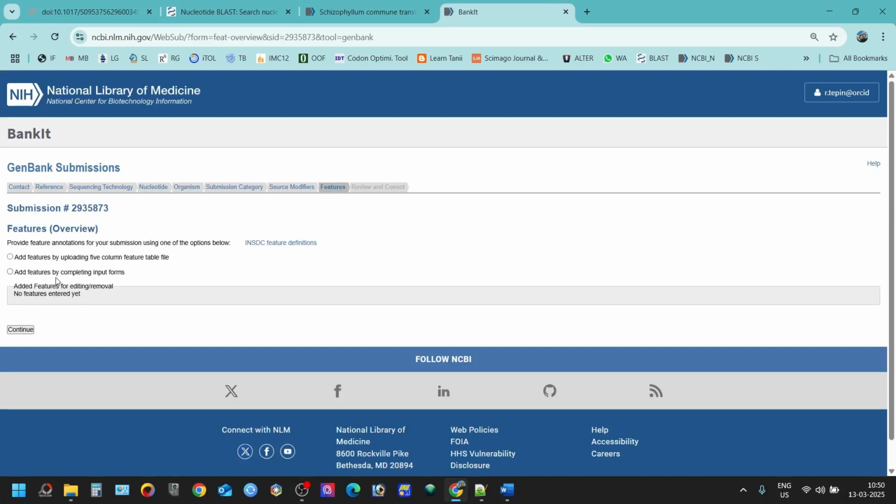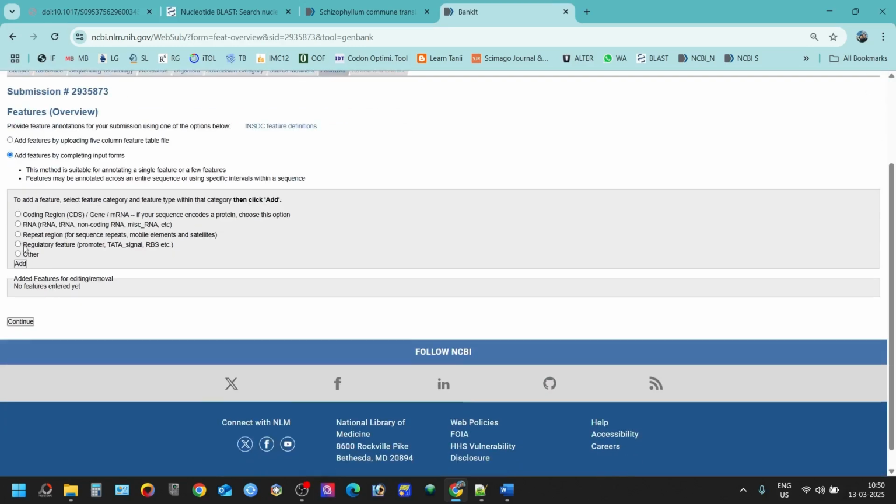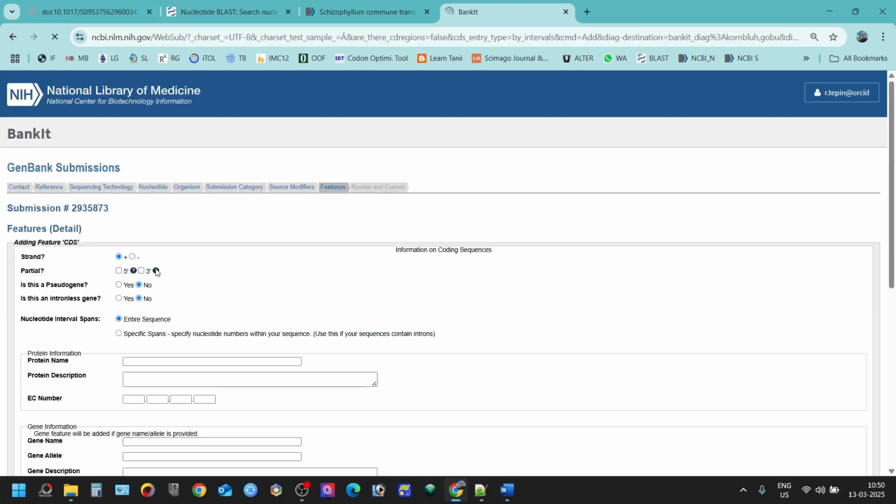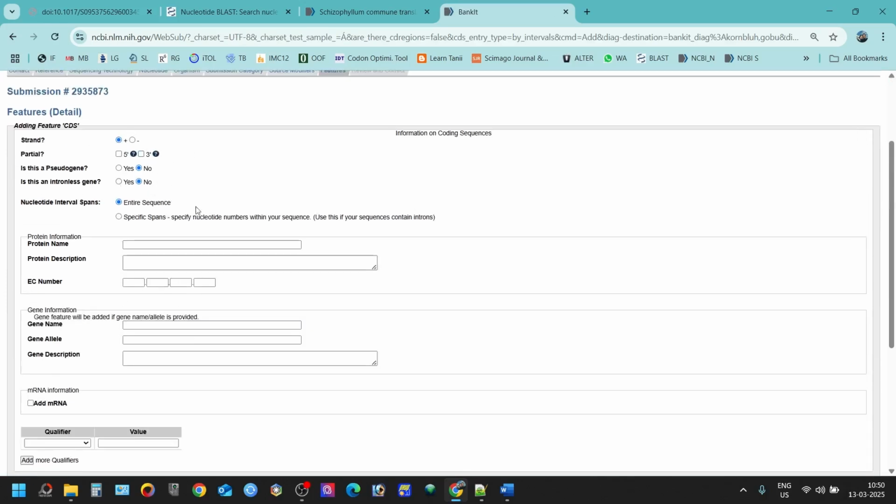And here you have to do certain things before submitting. So we have coding region. We are providing intervals. Even if you do this, you have to provide this protein sequence data. So that is quite complicated. So first I'm going to show you how to do protein intervals. You can click here, add, and you will find things like this. So what we are going to do now, how we are going to specify our introns, exons, and all that stuff. So in this lesson we're going to learn that.